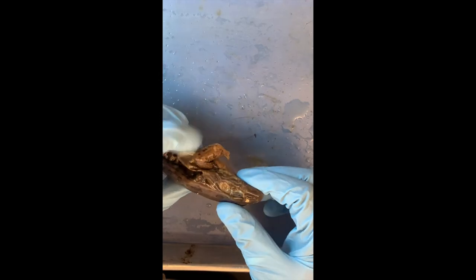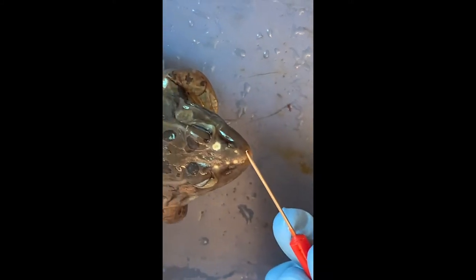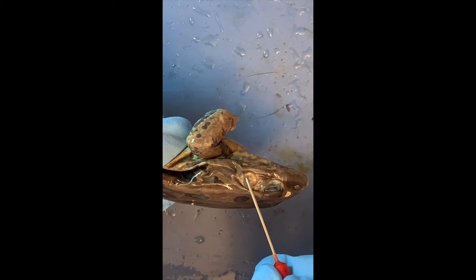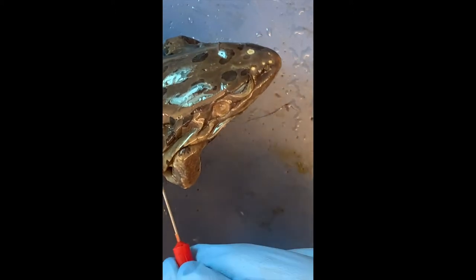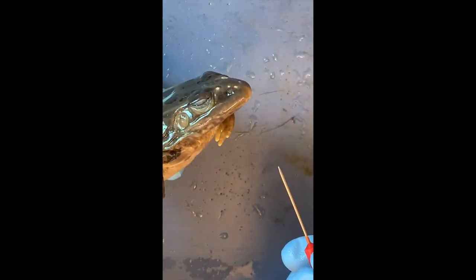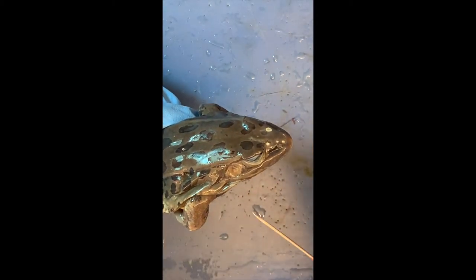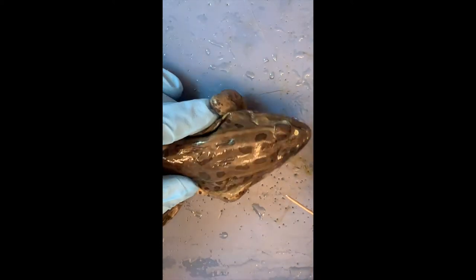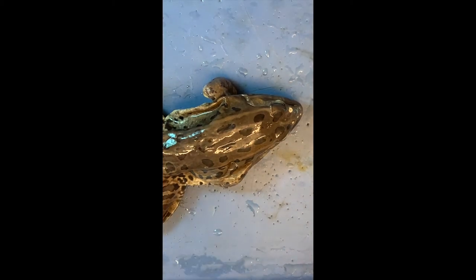If we keep looking at the external anatomy, we see something we've seen before in the grasshopper — this circular membrane. What is that? The nose is right here. That little membrane, like a drum — that's the tympanum. For the grasshopper it would be somewhere on the body, but now it has moved to the head. So there's no ear like we have — no pinna, no external structures. It's just the eardrum. They can hear each other very well and they're pretty loud.